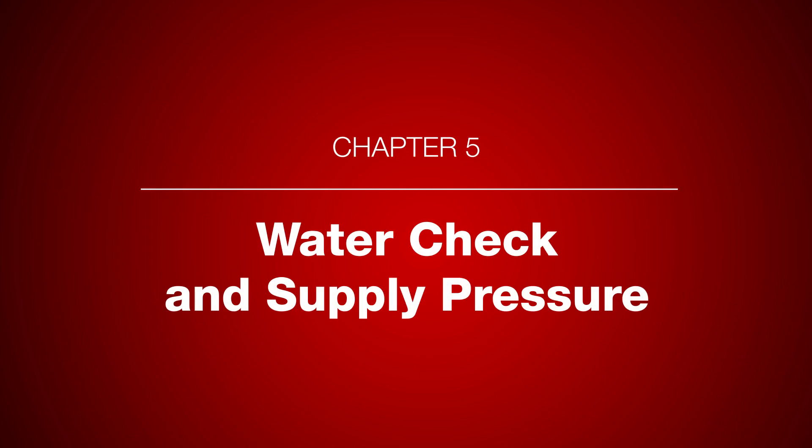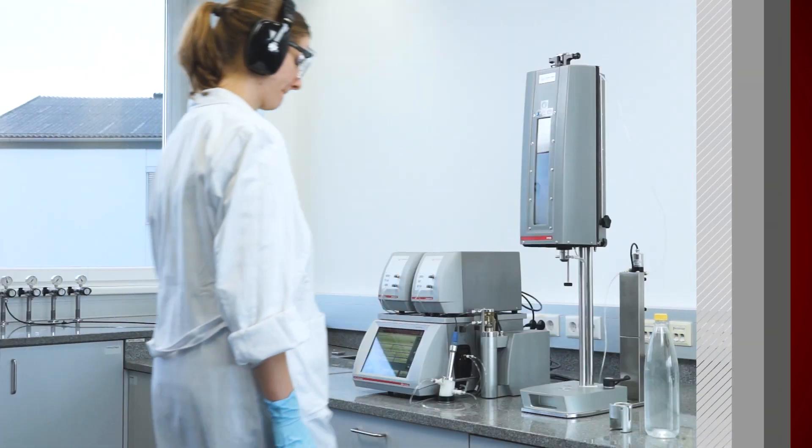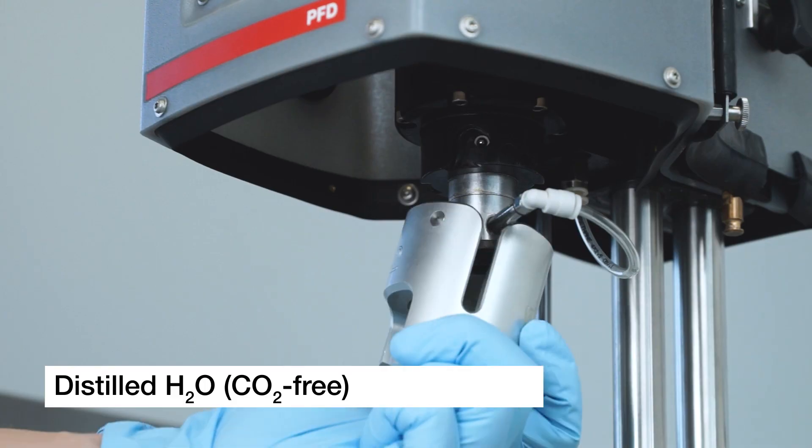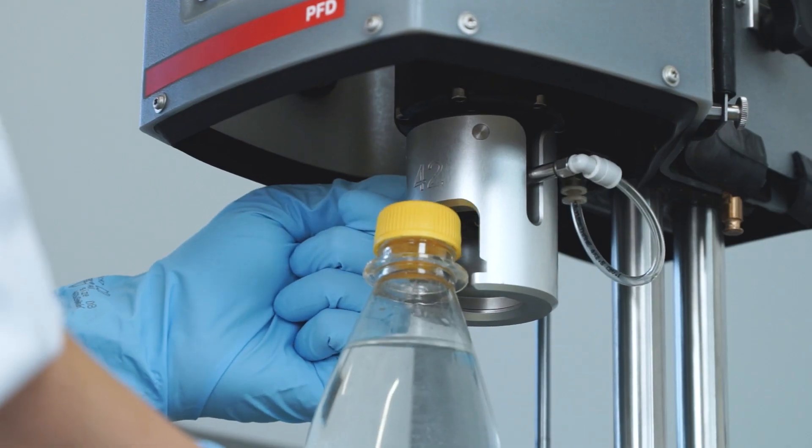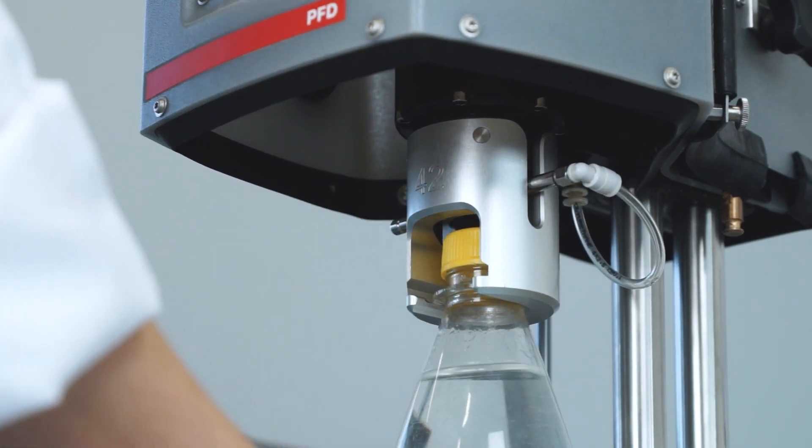In order to validate the performance of your setup, perform a water check every day in the morning or before starting the routine analysis before each shift. To do so, use distilled and CO2-free water and activate the sample transfer.